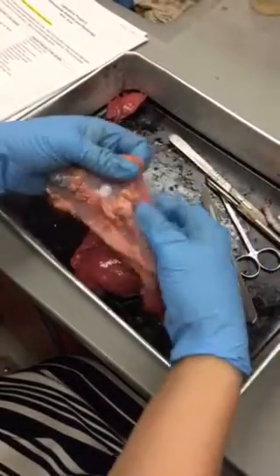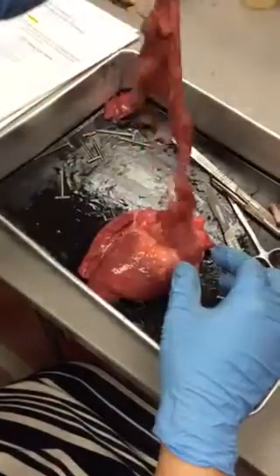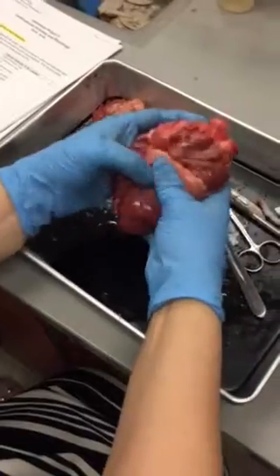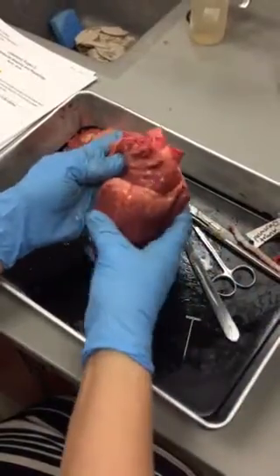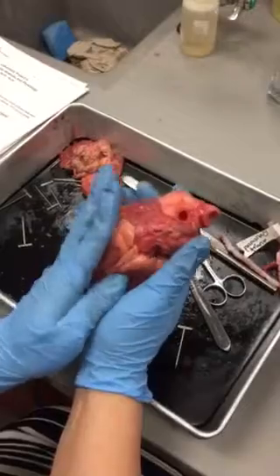All right, so this is what you guys cut off first. This is the pericardium, right? So everybody cut the pericardium off, and then you have to identify some external and internal structures on the heart. I'm doing their heart because their heart has some good vessels that I already identified. So it'll make it a little bit easier.